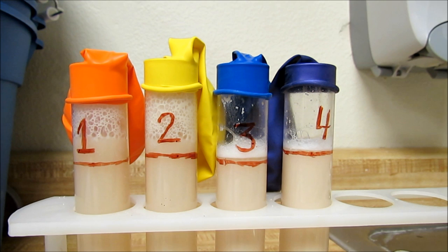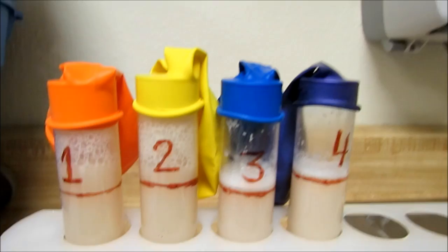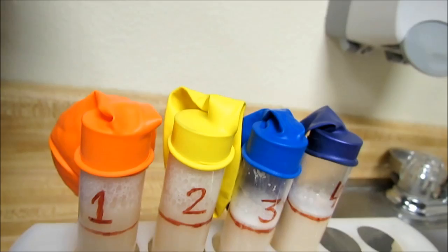So it has been ten minutes now, and you should be taking your observation for ten minutes. Let's get you a little closer look of what's happening with the balloons.